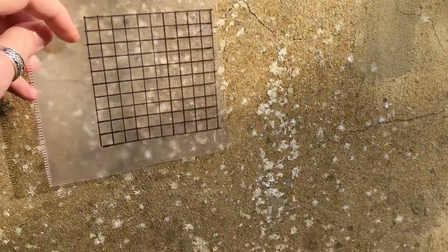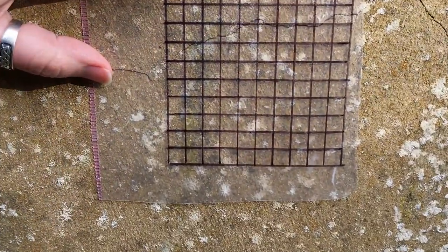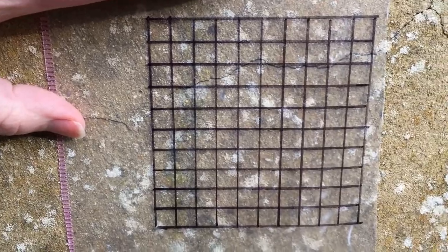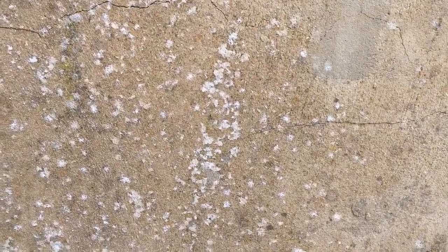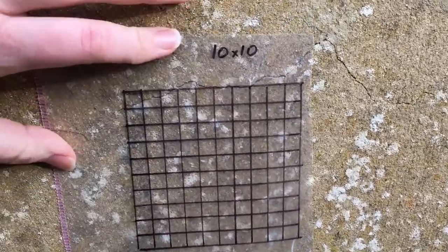So when we have our measure of using our random number generator, which is literally just Google roll dice and it will give you a random number, you can work out on your marks on your wall, which I haven't done because the children have stolen the chalk. I don't know where they've put it.